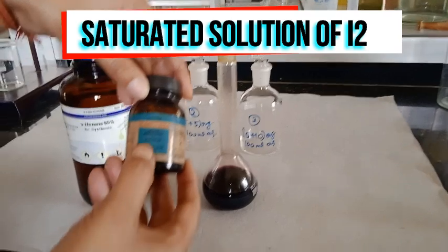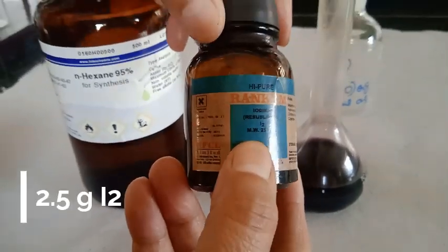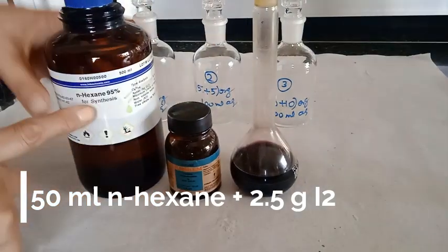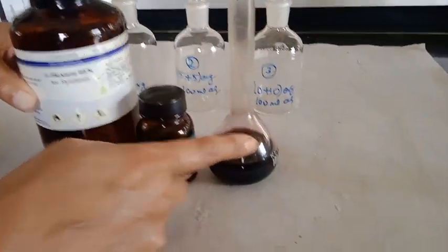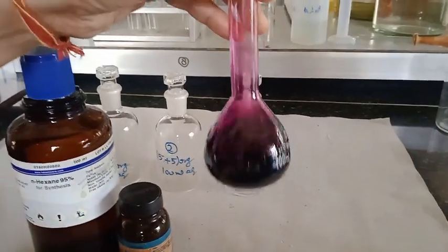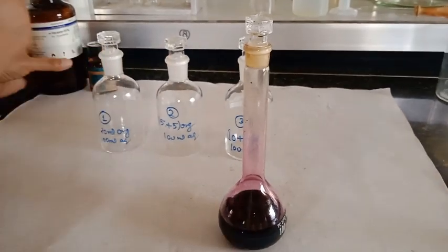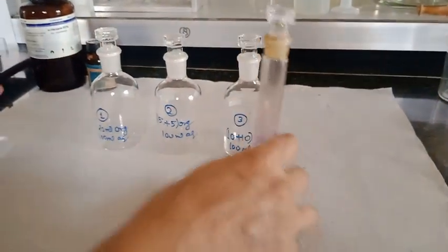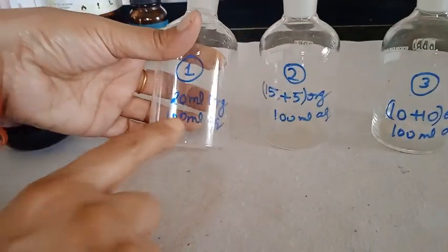So to prepare saturated iodine solution, we are going to have 2.5 grams of iodine in 50 ml of n-hexane. You can repeat the same experiment in carbon tetrachloride. Since that is not with me, I couldn't do that. Here we are preparing three sets. One is 20 ml of organic layer, 100 ml of aqueous layer.